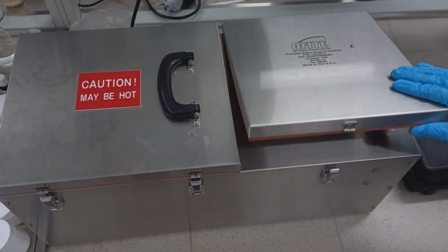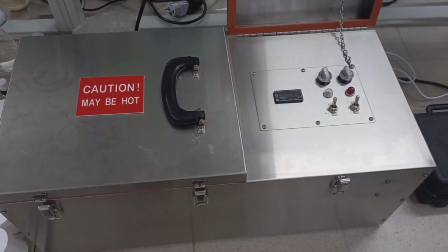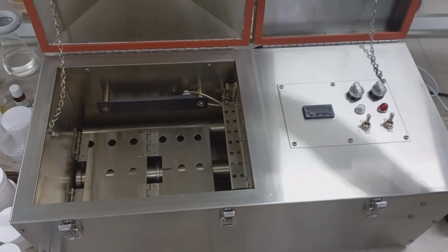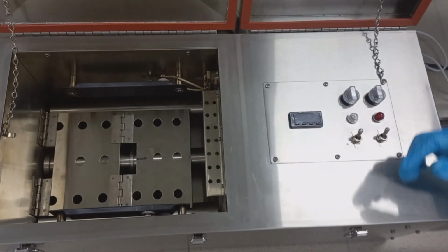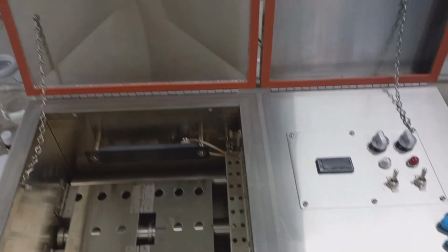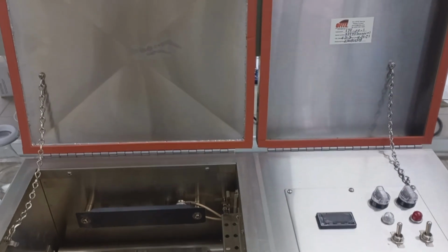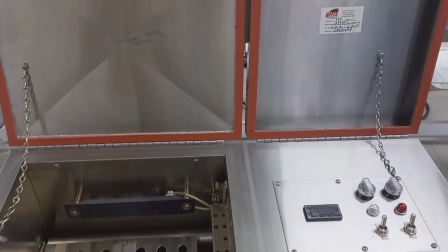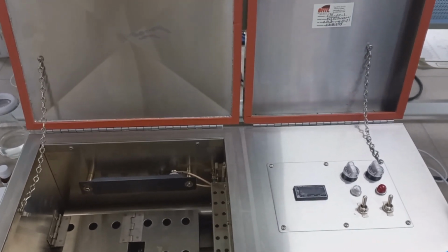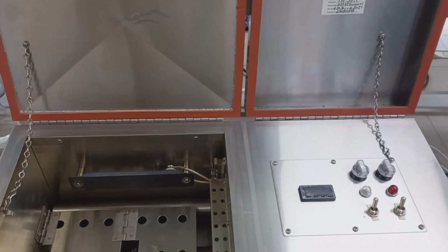The portable roller oven is an effective instrument to determine the effects of temperature on drilling fluid as it circulates through the wellbore. Aging the drilling fluid in pressurized containers effectively demonstrates the thermal effects on viscosity and how various additives behave at elevated temperatures. Aging is done under conditions that vary from static to dynamic and from ambient to highly elevated temperatures. This device can operate at temperature as high as 230 C.